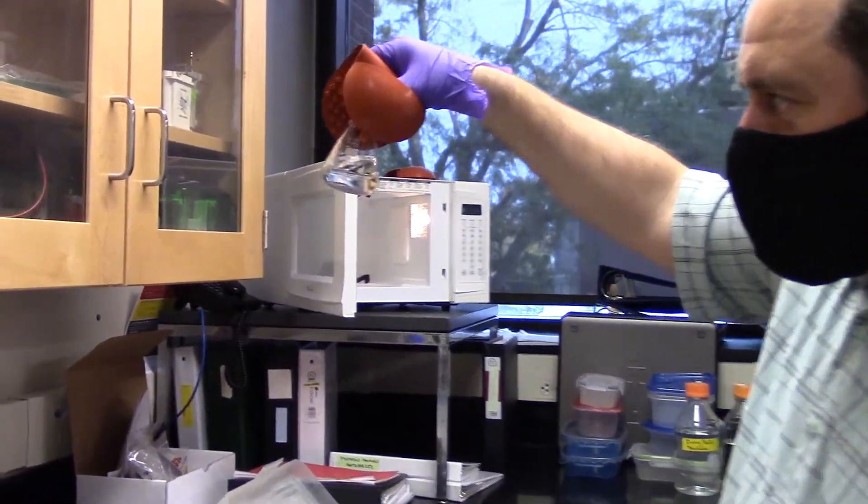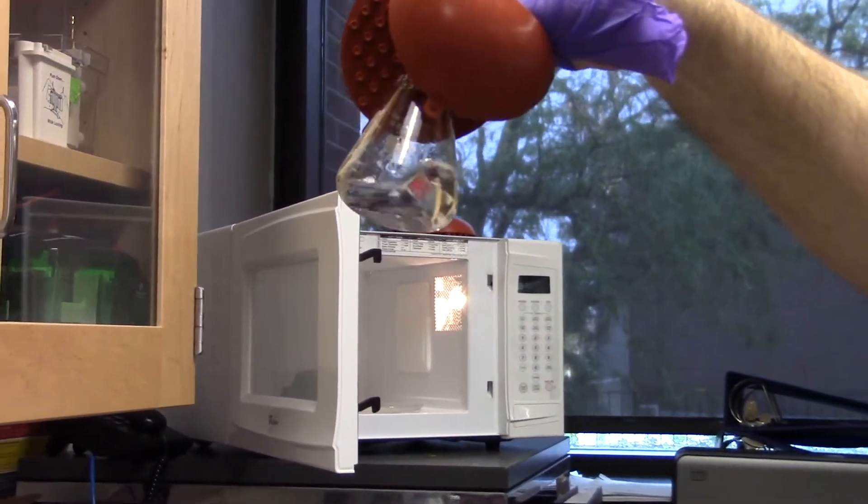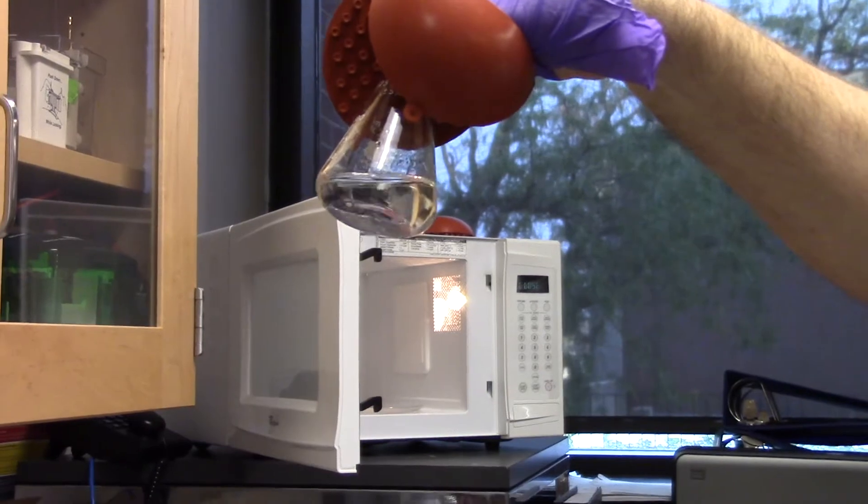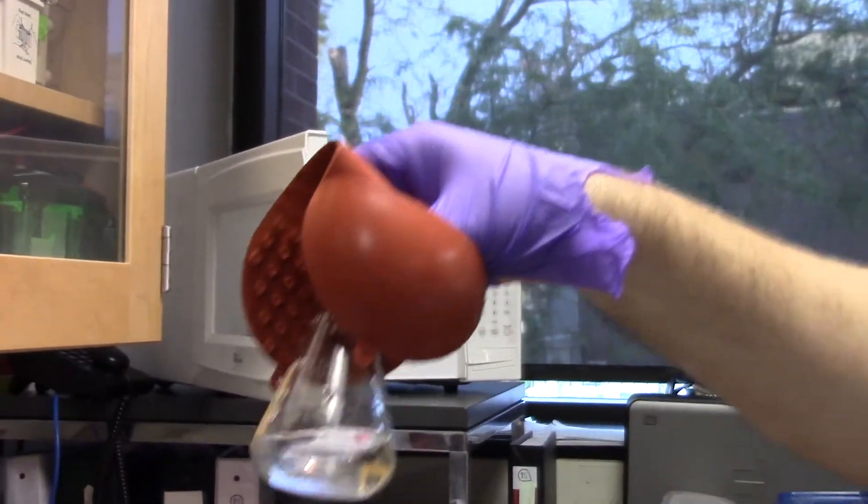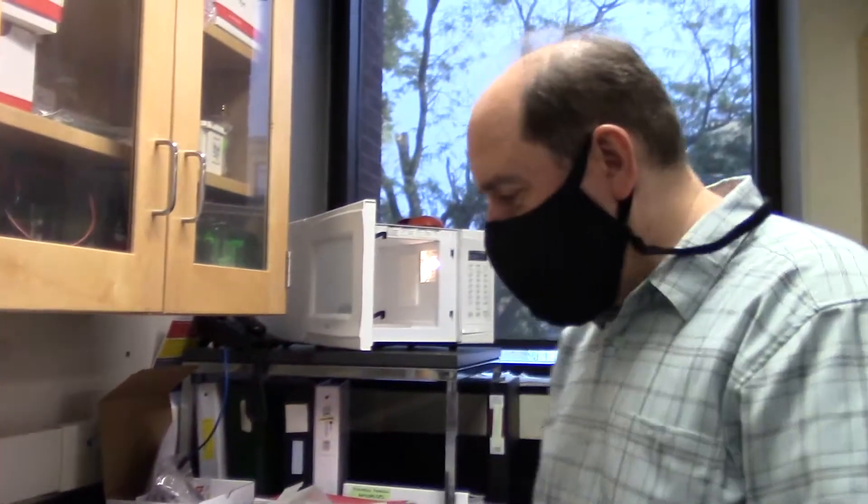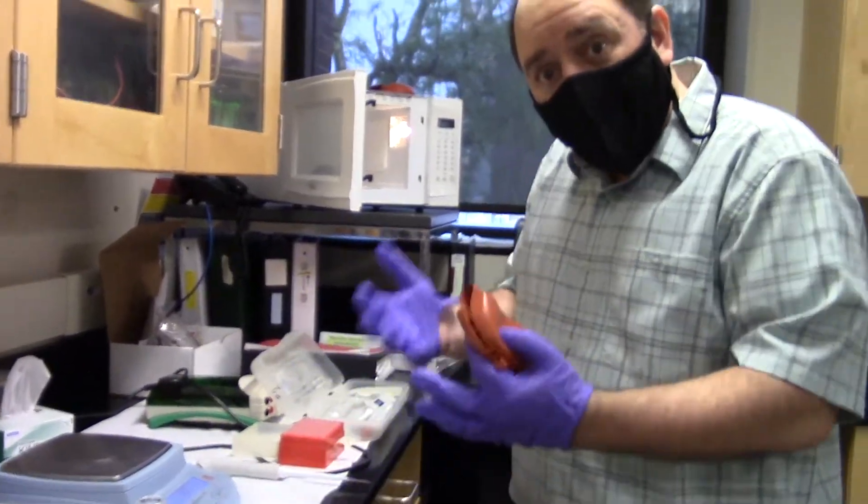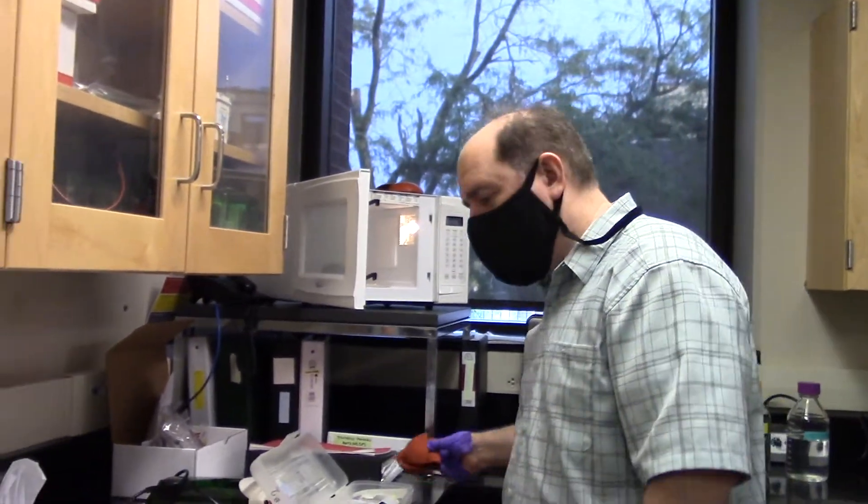Now you can see that the liquid is completely clear. That clear liquid contains completely dissolved agarose. And of course, this is much too hot to hold without the grabber grabbers. That way I don't burn my hand, especially since this was hot enough to the point where it was boiling quite vigorously.